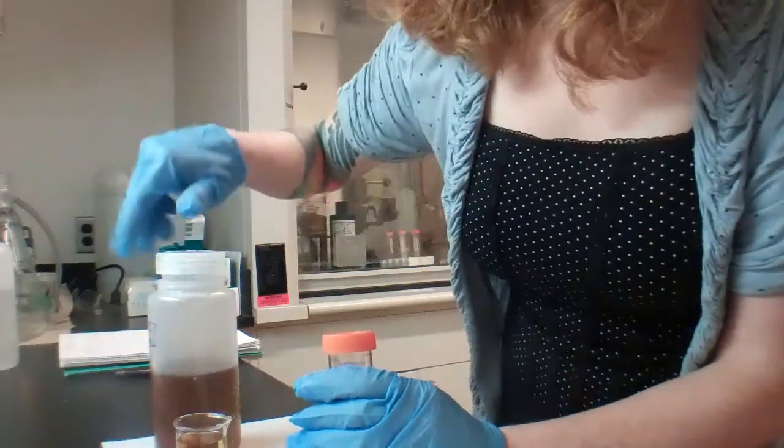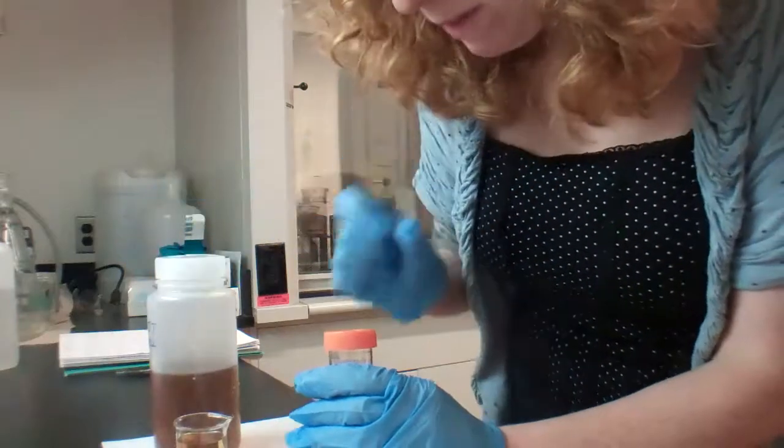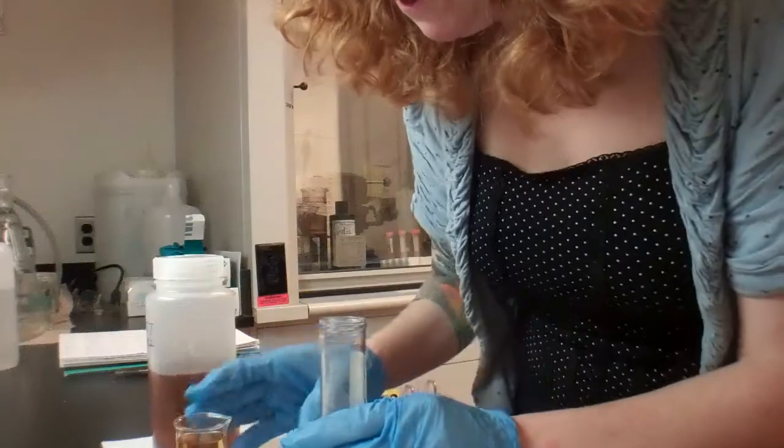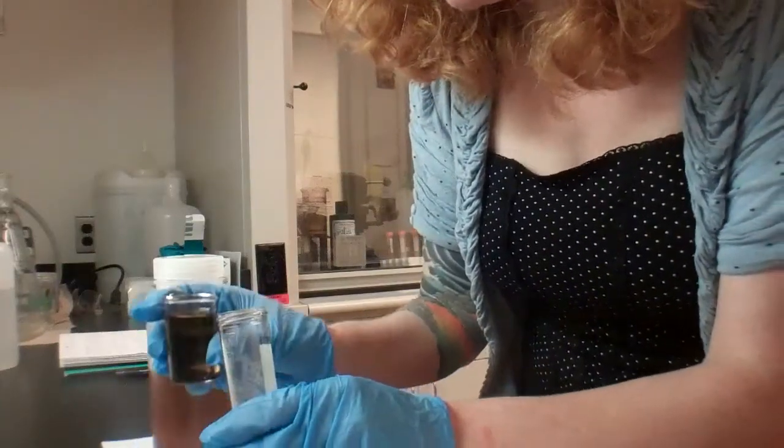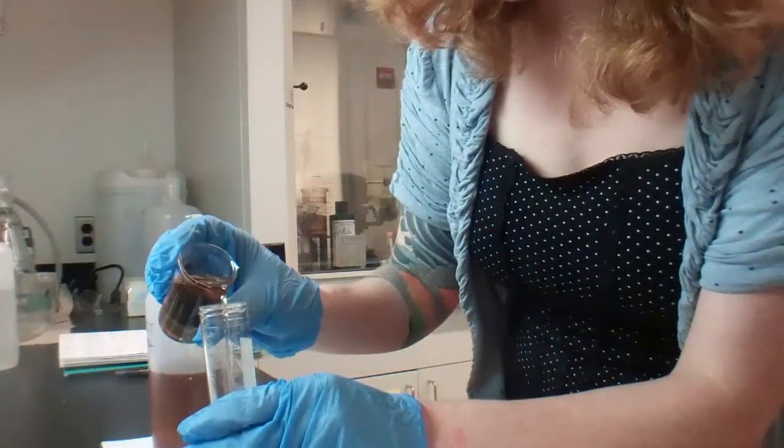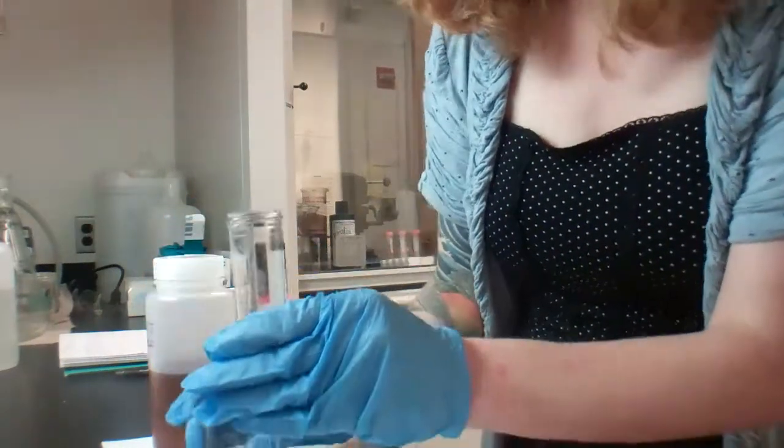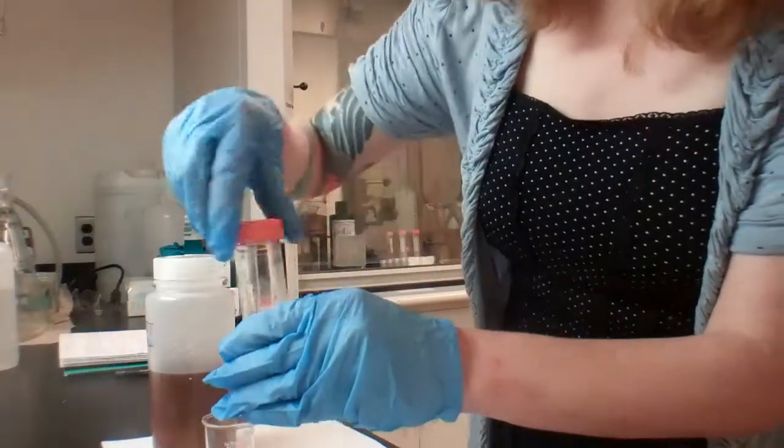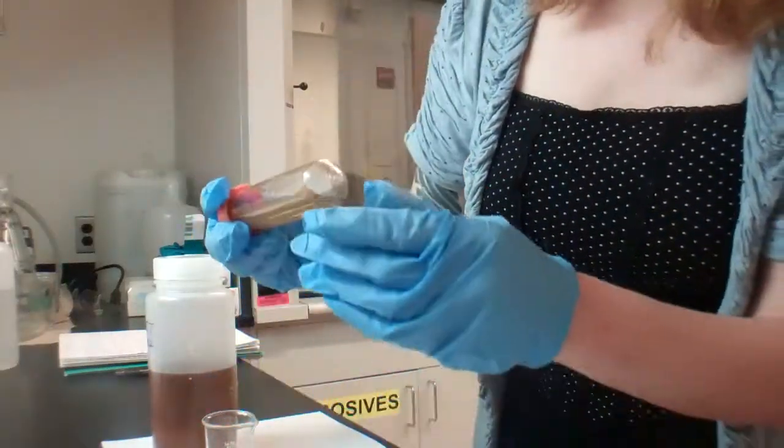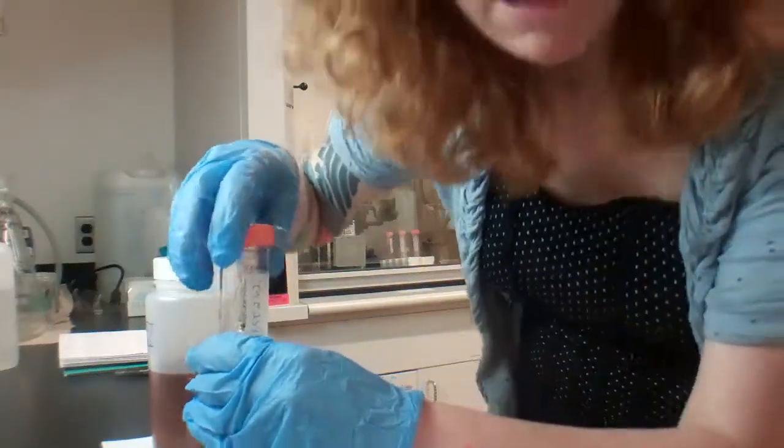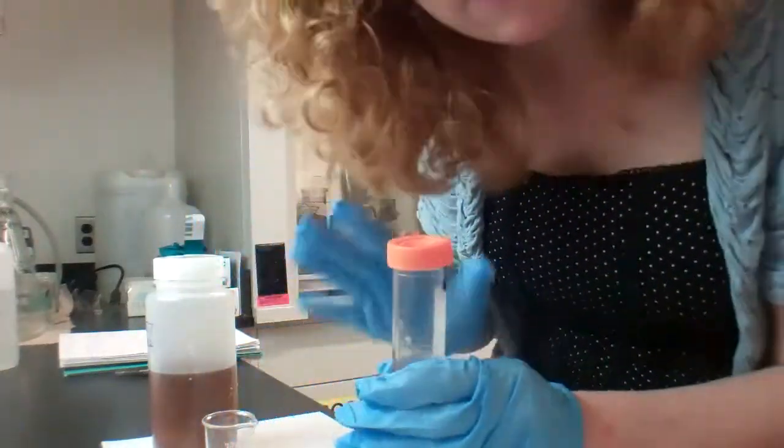Alright, so now I've filled up a small vial of the cutest little beaker, and I'm going to pour it in here, not all the way, just a bit, and then I'm going to whoosh it around. Oh, that button. Oh my god. Make sure you put it on tightly, but this is good.